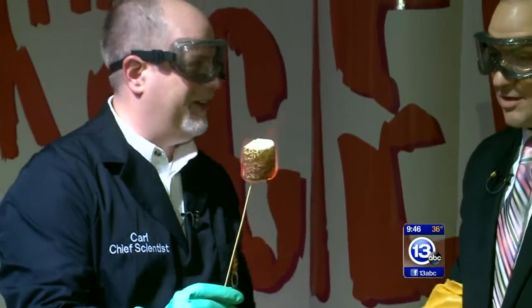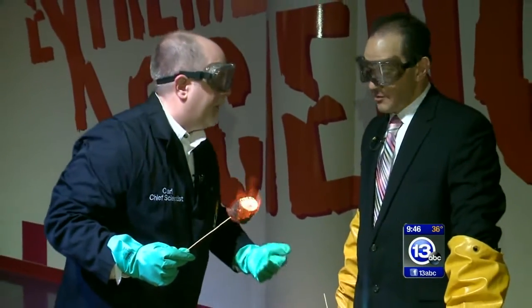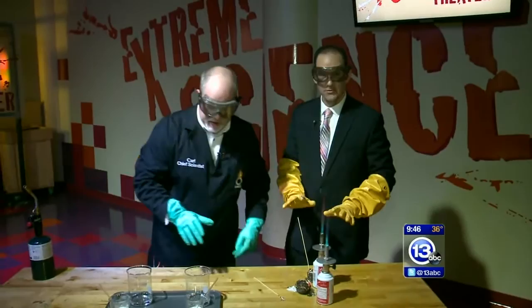Too close — we're going to carbonization. Well, I just got it too close to the flame. I wasn't being careful enough. So let's push these out of the way and just drop that right on the table. It'll go out.